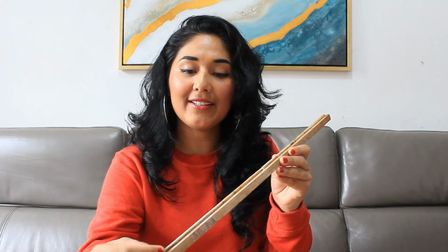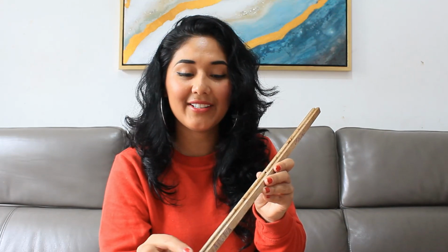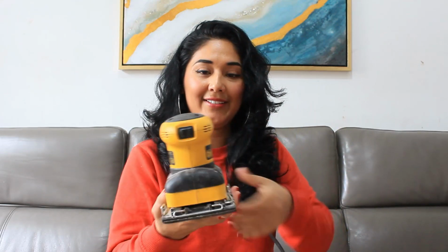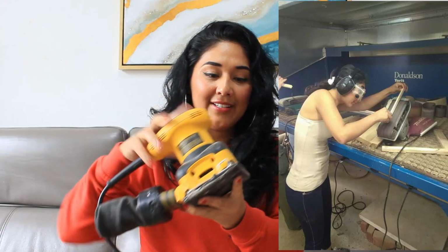Referring to our sample core, firstly the tree ring is not clear, but when we sand it, each ring is more clear. Our tree rings are distinctive. In this sense, it's possible to follow the next process, using this mechanical equipment.